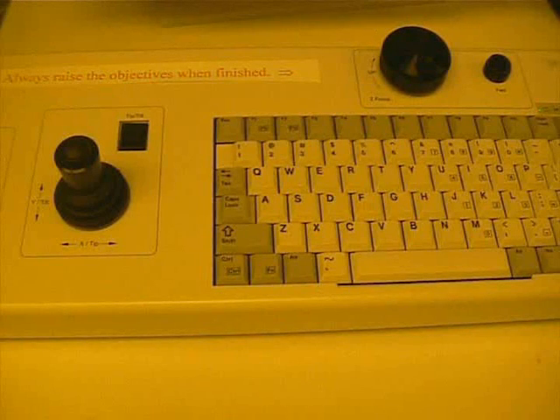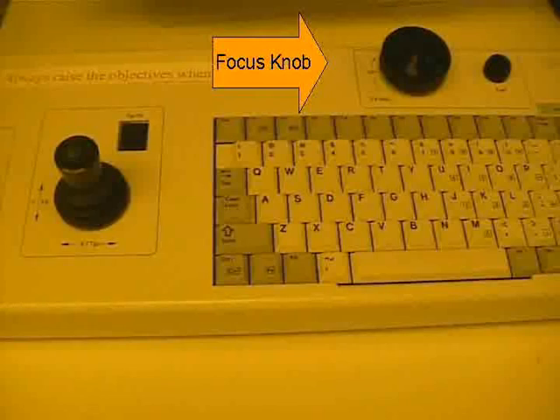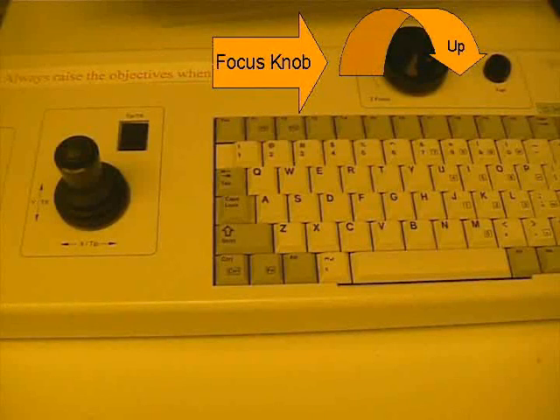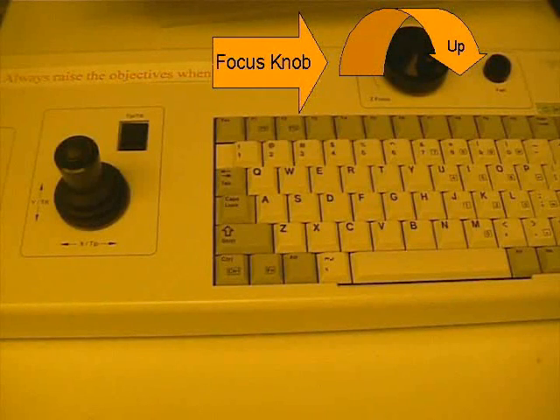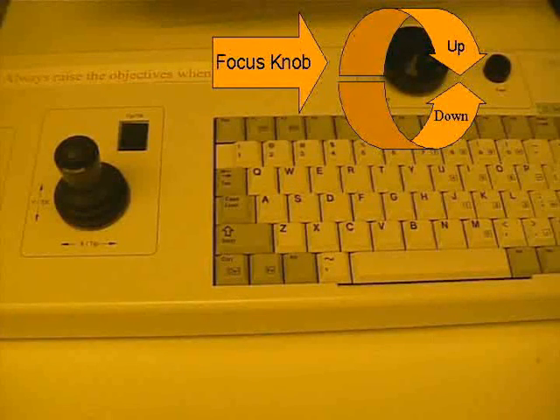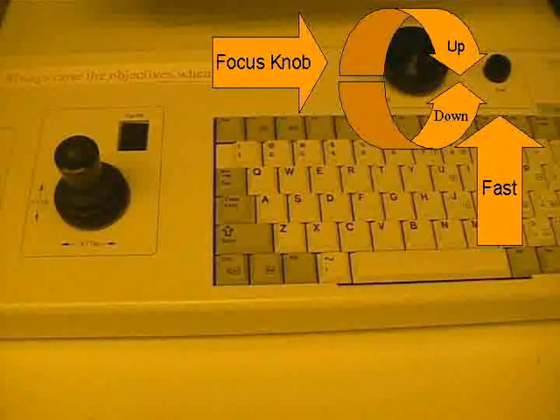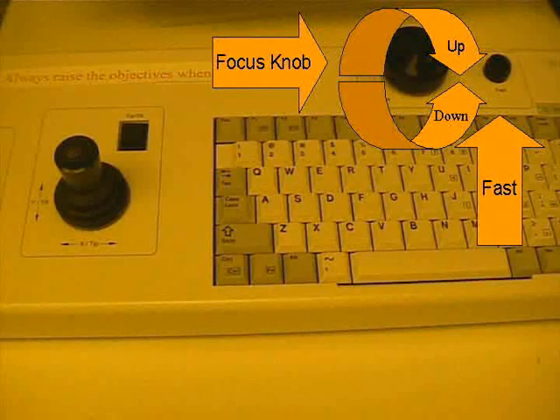We can raise or lower the objective lens by rotating the focus knob. Rotating right moves the objective lens up and rotating left moves the objective lens down. Pressing the fast button can change its speed.